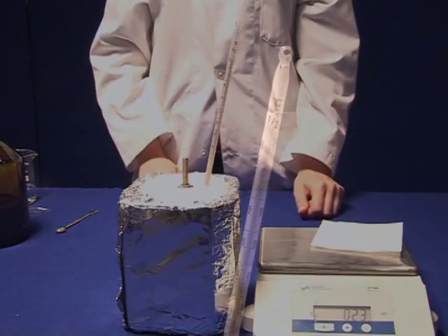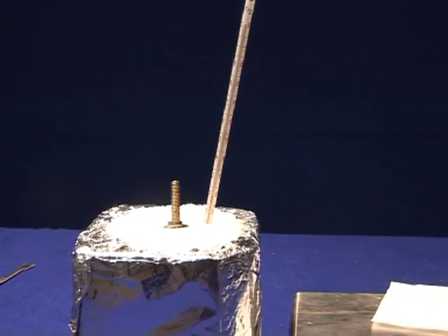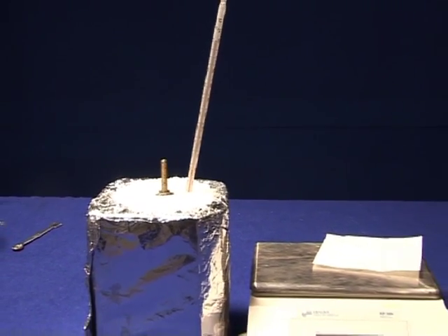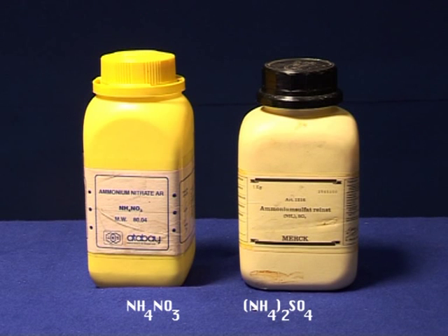Continue taking temperature-time data for 10 minutes. Repeat the procedure for ammonium nitrate and ammonium sulfate.